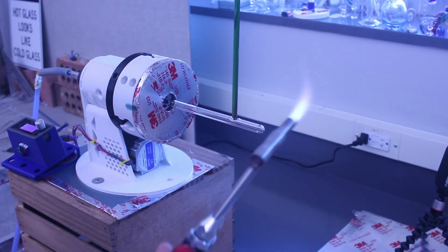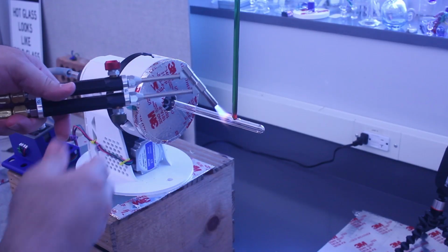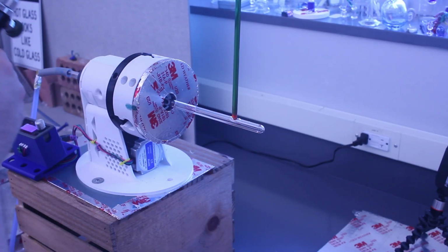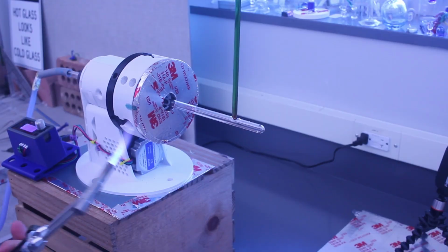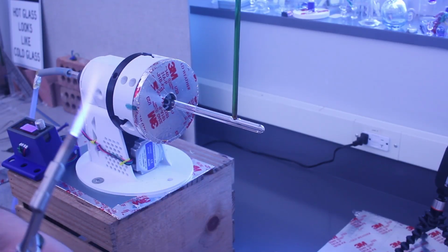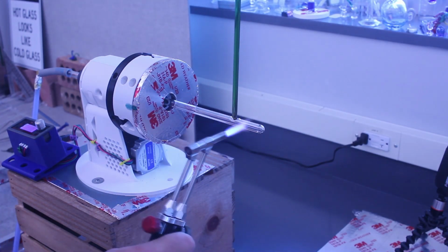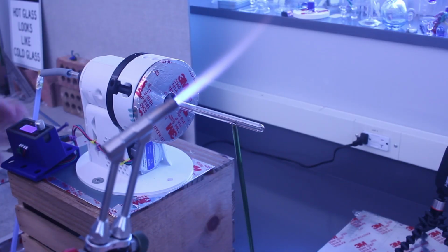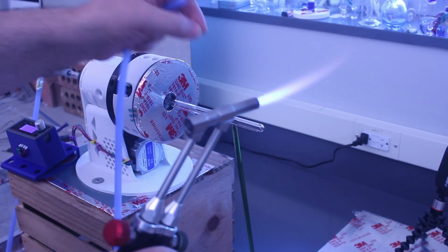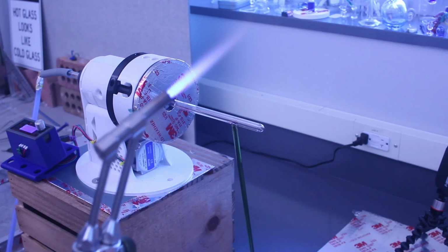And if I need to, again, I can come in, heat, puff. The goal is, of course, to have the interface between your glass tube and the rod as uniform as possible to prevent any stress. So now at this stage, I could heat the other side and put another piece of glass rod on here, or do whatever else I want to. So that's one of the advantages, again, of having it in the lathe.